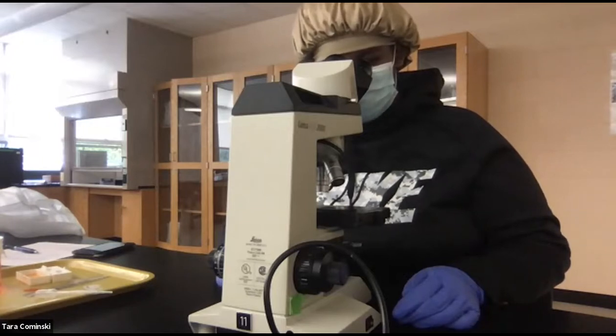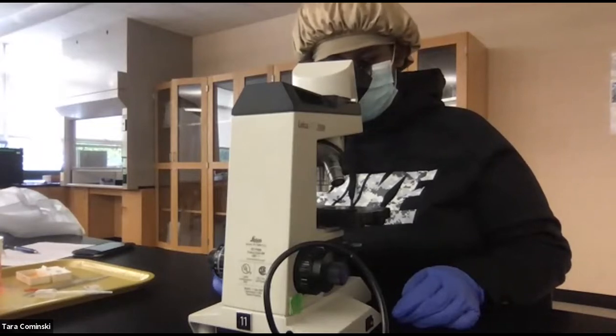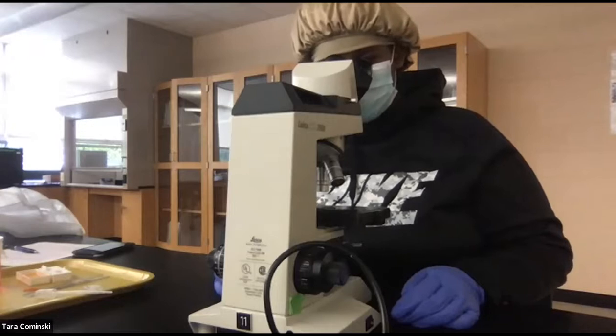Anyway, we'll switch up. You can pull your slide out of there and put it in this one. All right, so get it in focus under scanning. That's your next thing to do. Slide it all the way back. Then that part goes in the corner there. Let me move this out of the way. You can slide that over if you want.